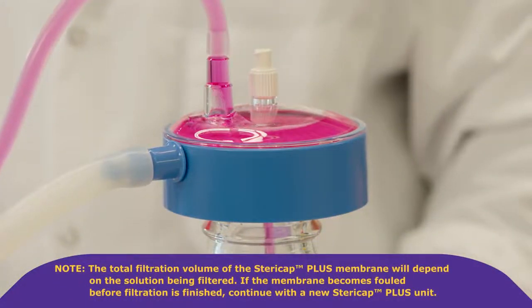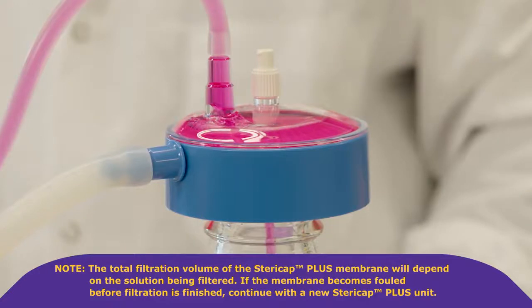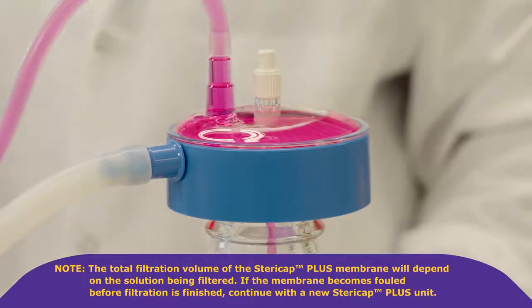Note, the total filtration volume of the SteriCap Plus membrane will depend on the solution being filtered. If the membrane becomes fouled before filtration is finished, continue with a new SteriCap Plus unit.